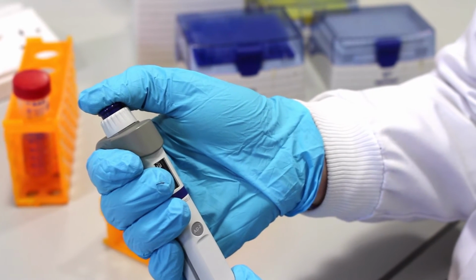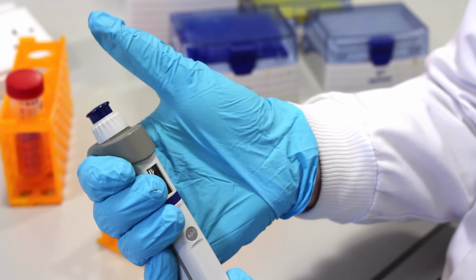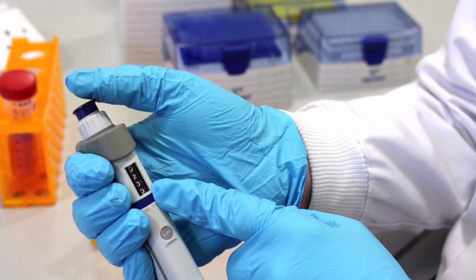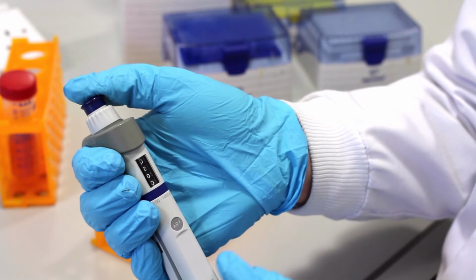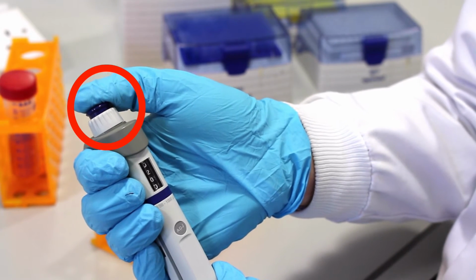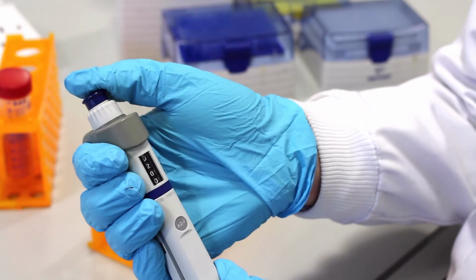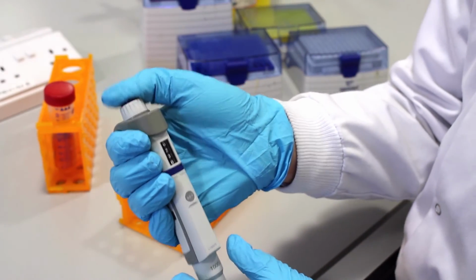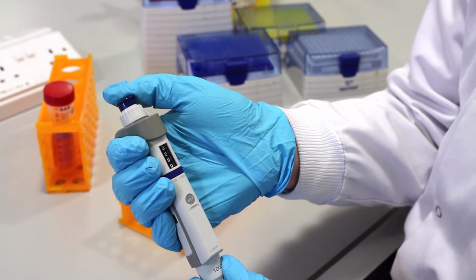If you pursue and go all the way down to the bottom and lift up, you will pipette more than 200 microliters, much more. So it's very important that when you're pipetting later on, we're only going to go to the first catch and then lift up 200 microliters. As I said, the only time we're going to go to the second catch is when we want to maybe expel the liquid into the new tube that you're aliquoting into.